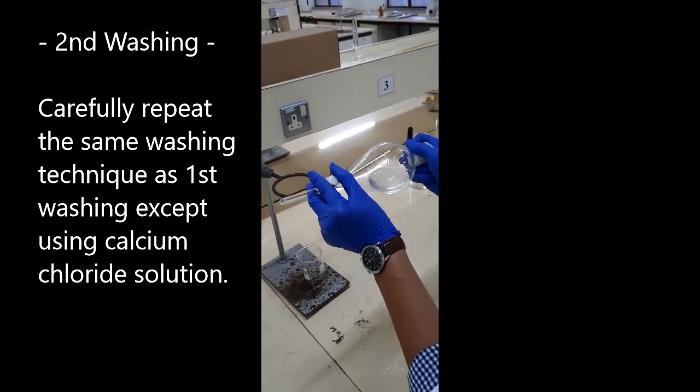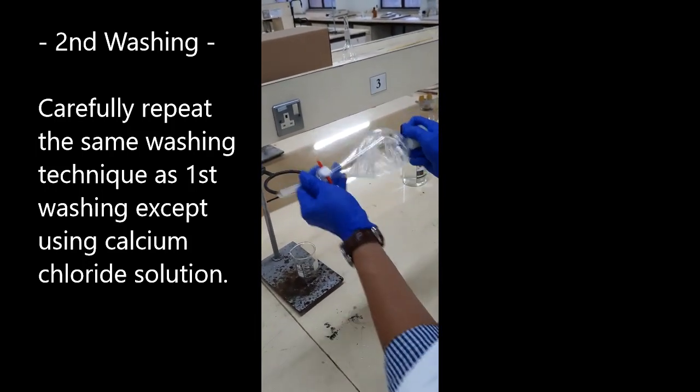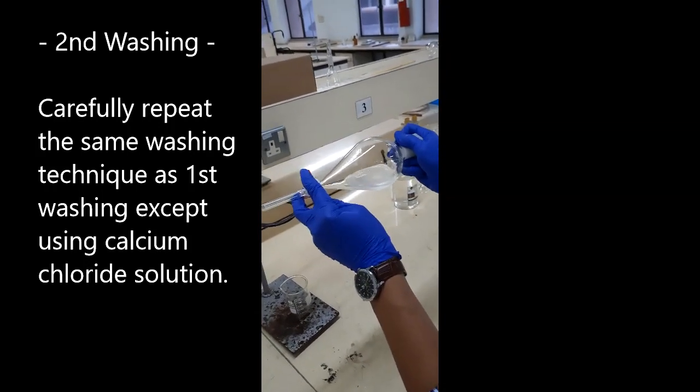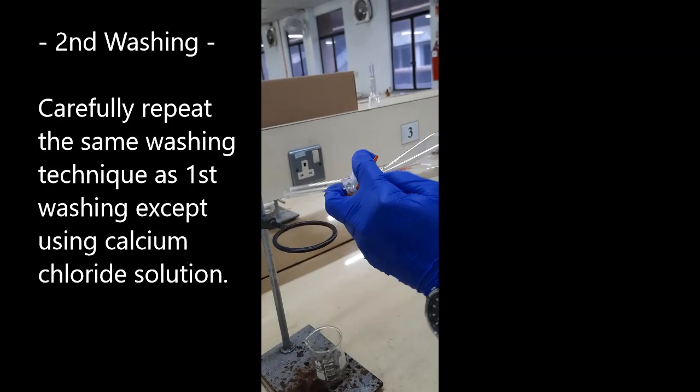Repeat the shaking and depressurization cycles until the liberation of gas stops.